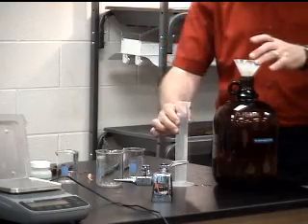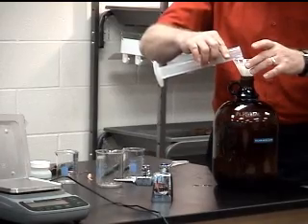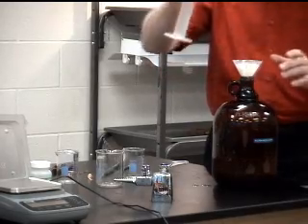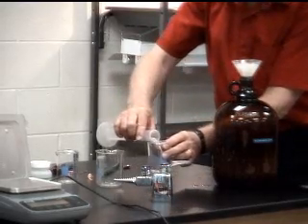Slightly over 100 milliliters. Just take that down. And we'll put it in a beaker.